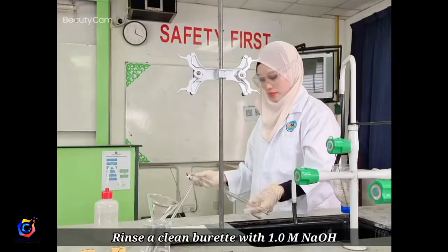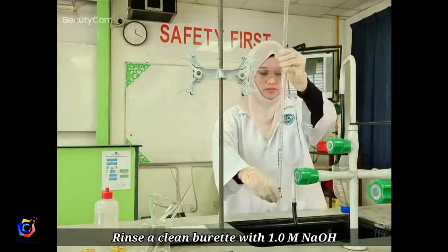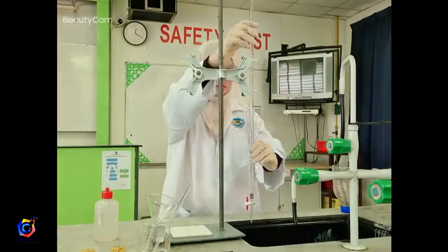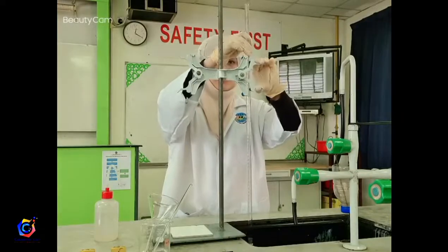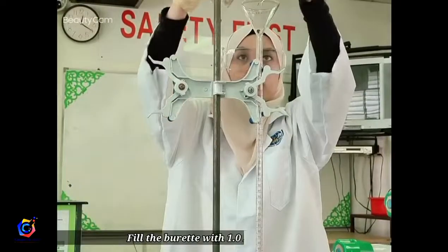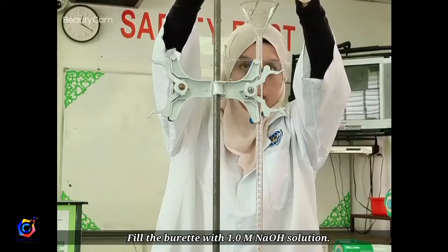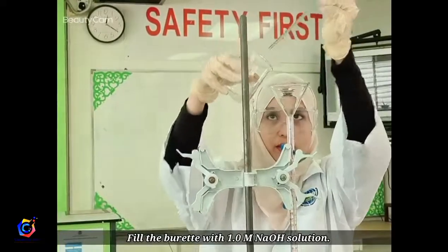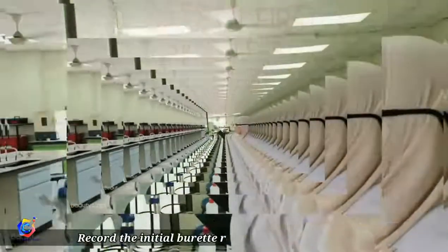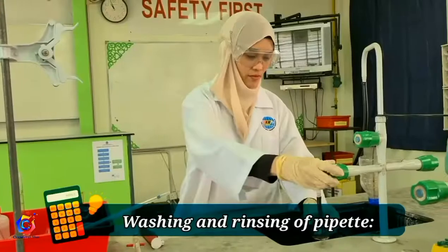Now we will rinse the burette with the solution to be used, that is 1.0 molar sodium hydroxide. Fill the burette with 1.0 molar sodium hydroxide solution. Remember, the initial reading is not necessarily 0.00.